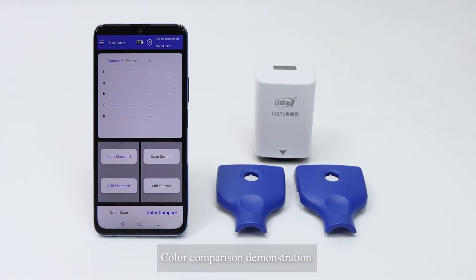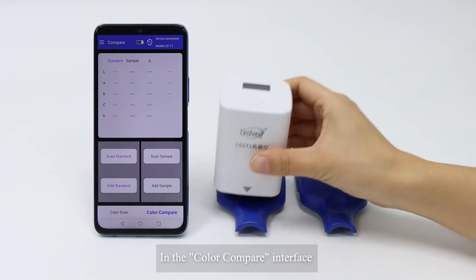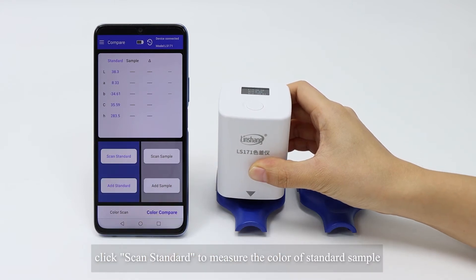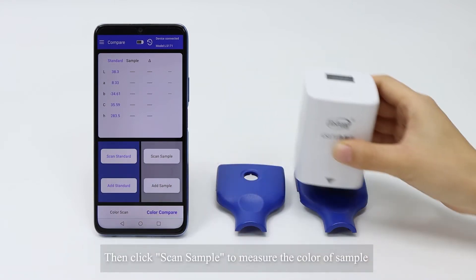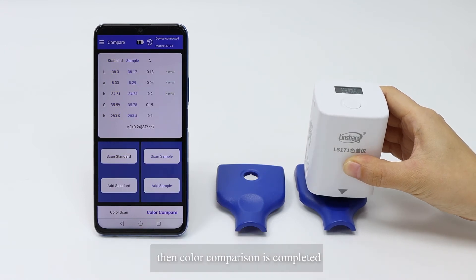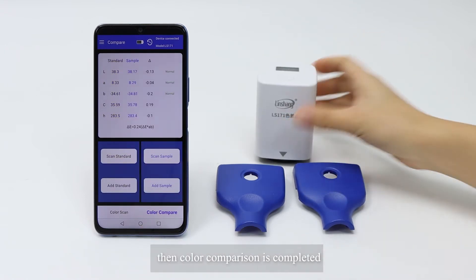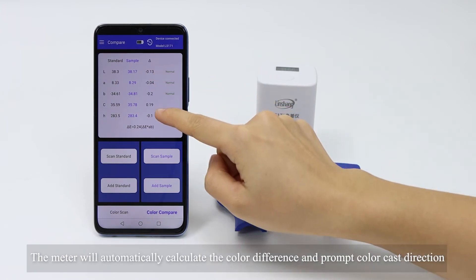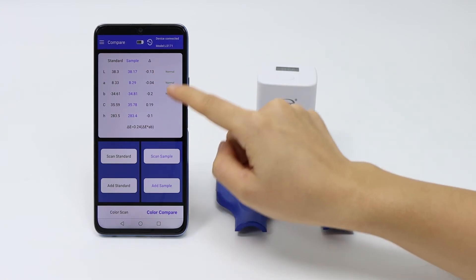Color comparison demonstration. In the color compare interface, click Scan Standard to measure the color of the standard sample. Then click Scan Sample to measure the color of the sample. Color comparison is completed, and the meter will automatically calculate the color difference and indicate the color cast direction.